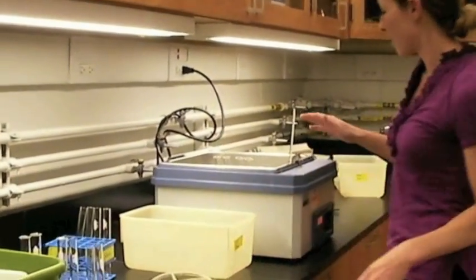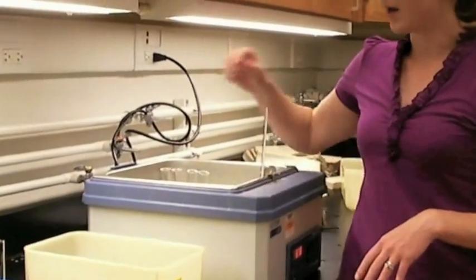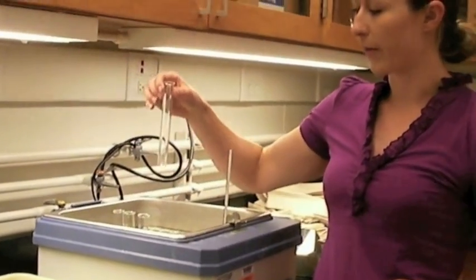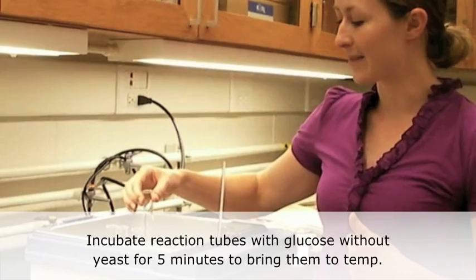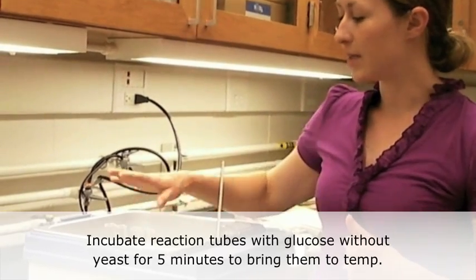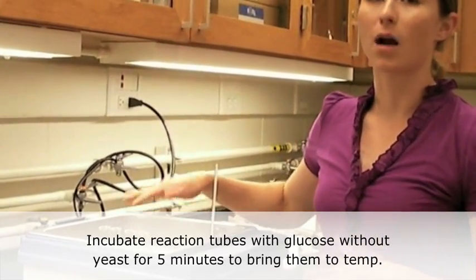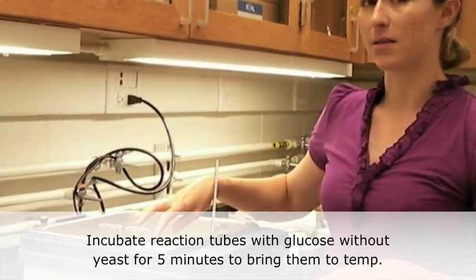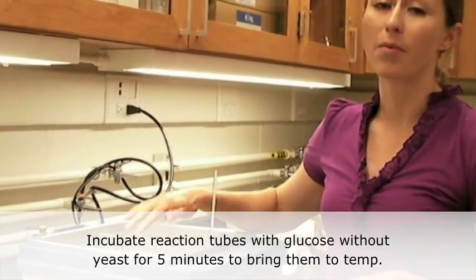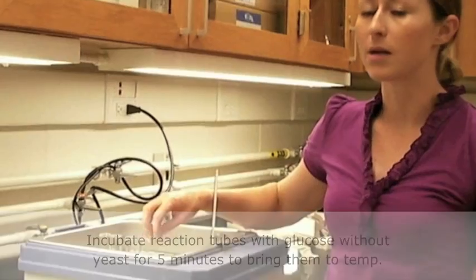In the setup over here, we have a water bath, and in this water bath you're going to set your reaction tubes after you've put your glucose and any other substances necessary for the reaction to incubate for five minutes to come up to temperature. It's notable that you have not added the yeast yet, so you're just bringing up the glucose and any test materials up to temperature.